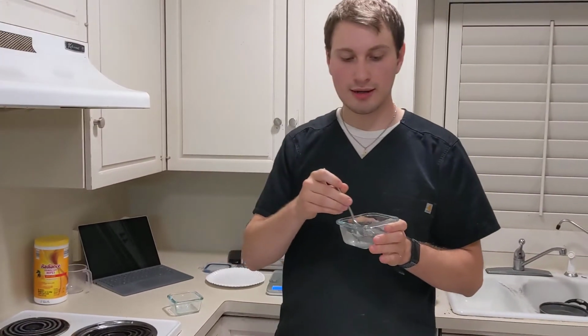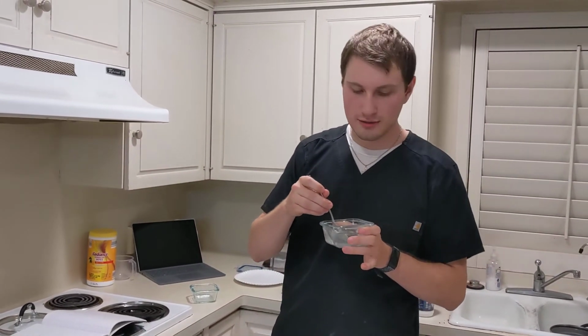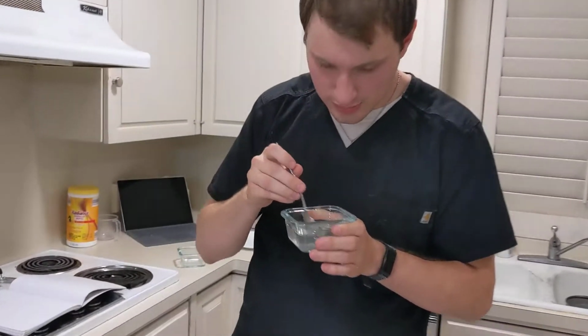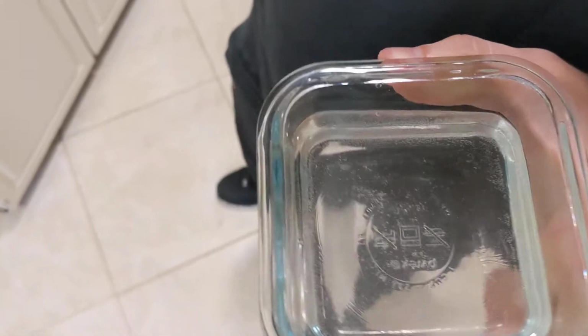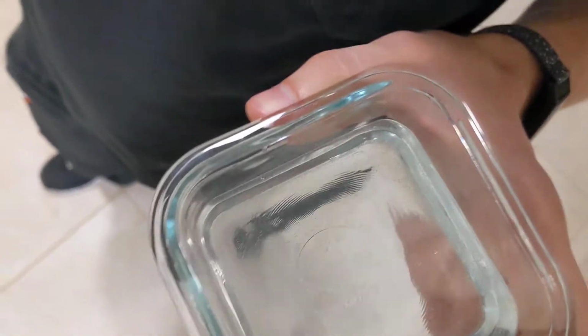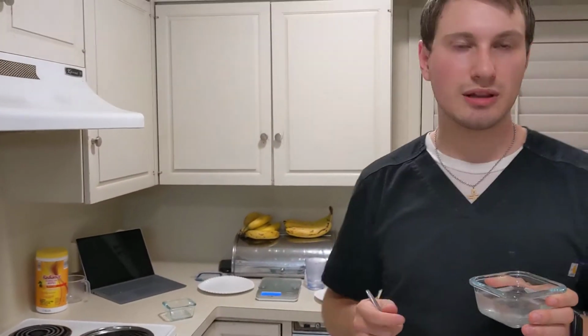And so by adding more water, that allows me to dissolve more salt, and eventually it will come to what looks like just pretty much, there's a few grains of salt in there, just barely, but now is pretty much as close to a saturated solution as I'm going to get without having a more accurate balance, maybe like an analytical balance.